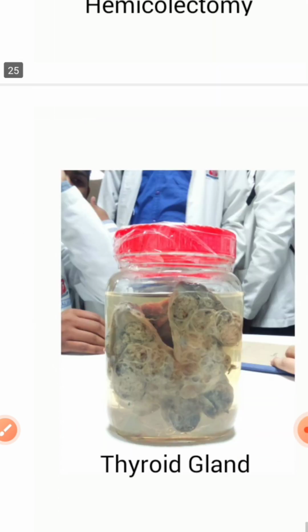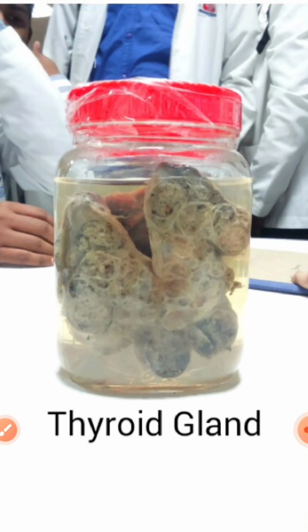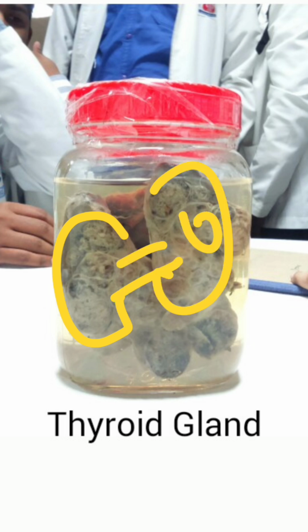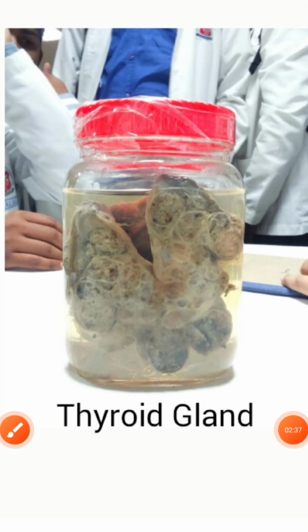Thyroid gland might also be kept. Most commonly it will be thyroid carcinoma or a toxic nodule or anything related to thyroid. You first tell there are two lobes along with the isthmus, and you can tell the color and multiple lobules. So this might be a thyroid carcinoma, you can tell like this.